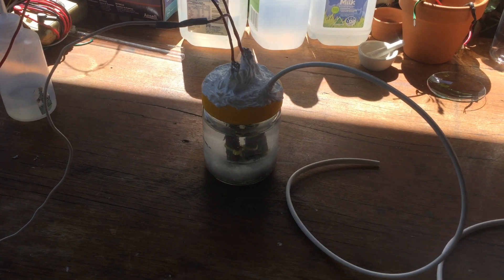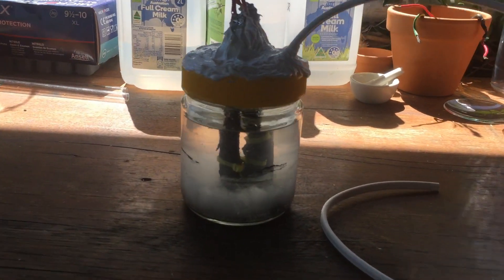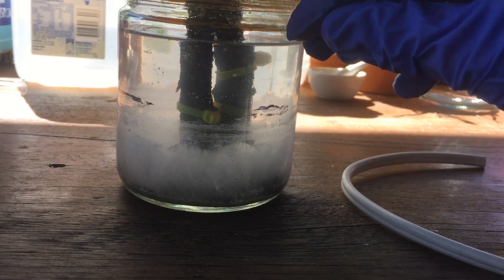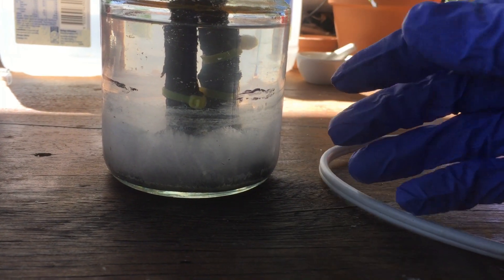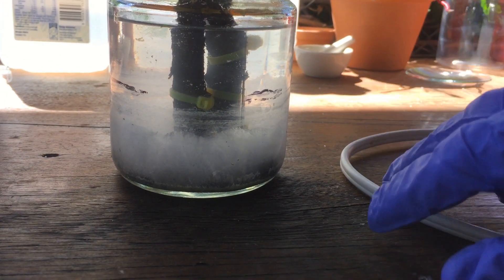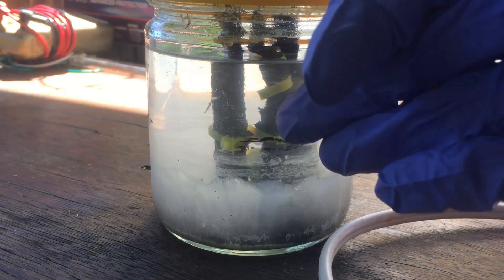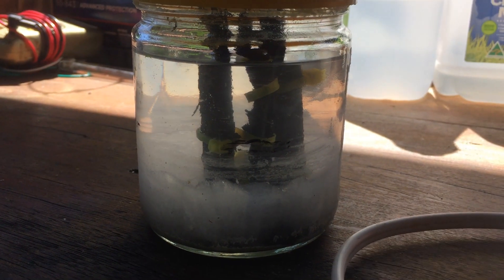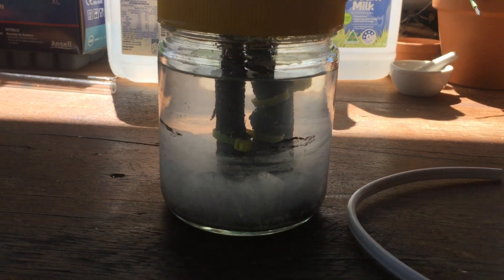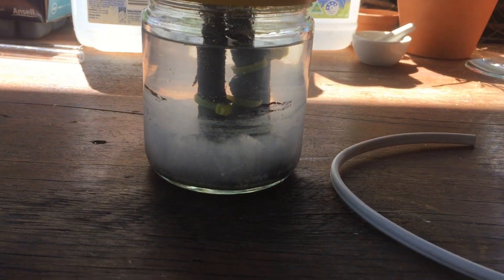Actually it's only been a day. I thought it would be pretty smooth sailing through this stage of enrichment, but we have run into two problems. You can probably see down the bottom there — all of the sodium carbonate has started to crystallise, because we're reducing the volume of the water, making it more and more concentrated in sodium carbonate, and it's crystallising out and impeding the current flow. Also, we've got a lot of spongy lead on the cathode, meaning the lead is slightly electroplating due to the impurities as the water becomes more concentrated. So we need to get rid of the impurities and reduce the sodium carbonate concentration.